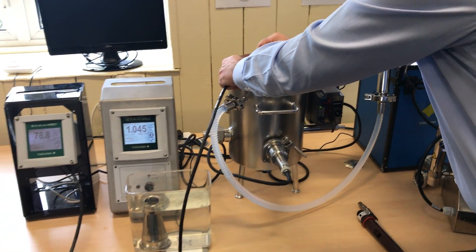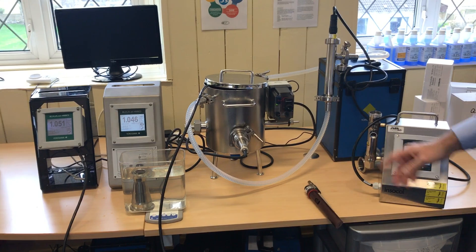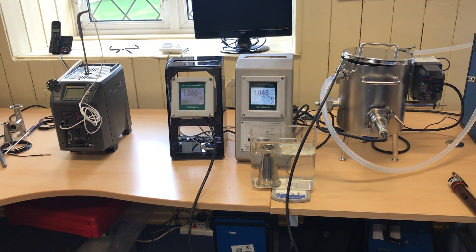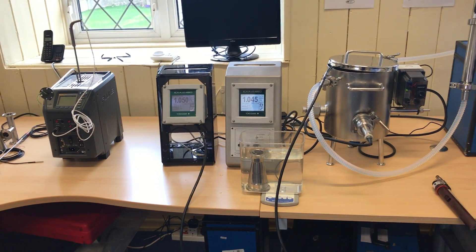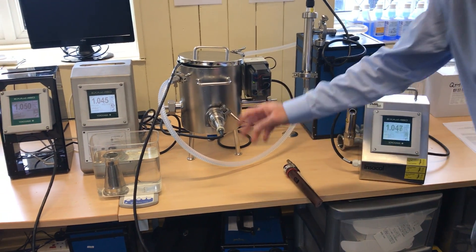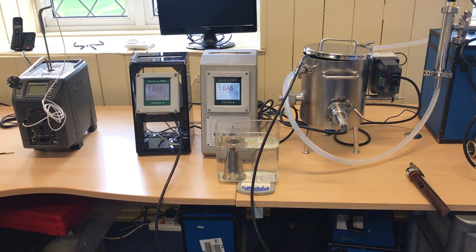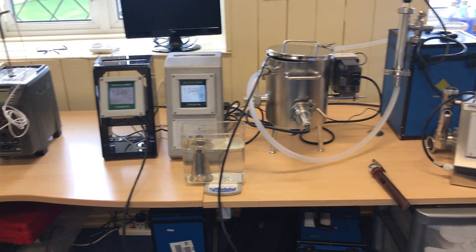All three systems are measuring within a couple of microsiemens of each other, and when we turn on the pump we will see all of them come within about 0.001 of a millisiemens, as they're correctly installed.